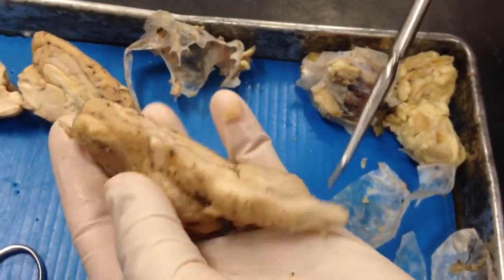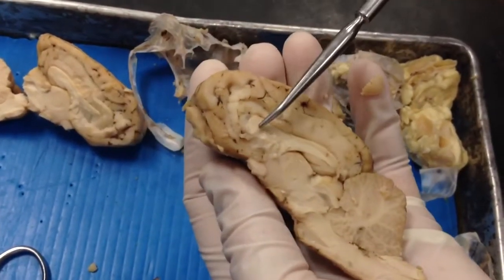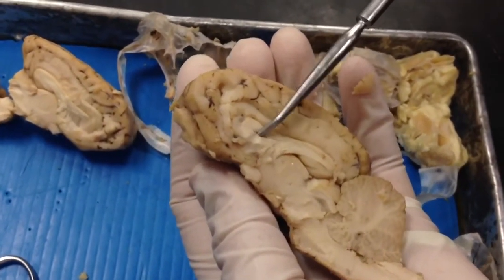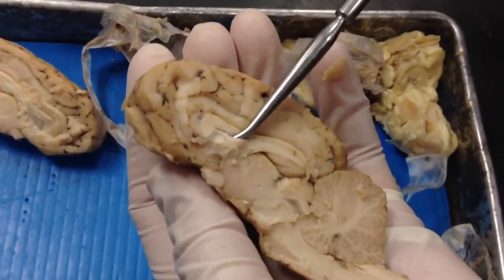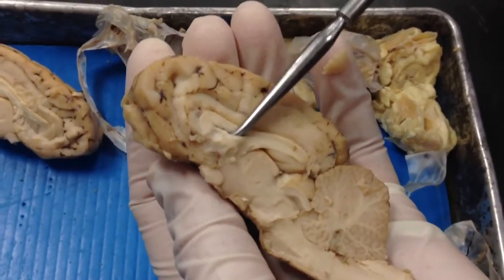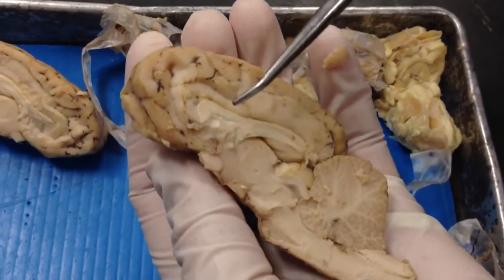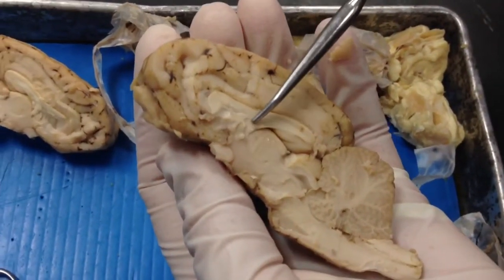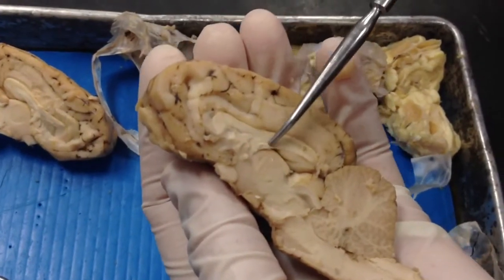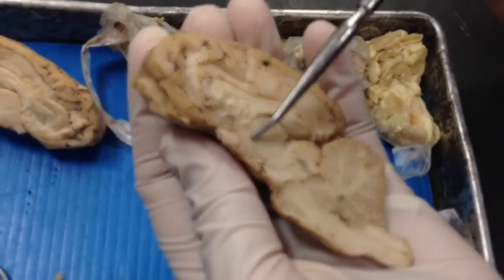The septum pellucidum is right here. The lateral ventricles are in here. The fornix is right here on the bottom. And the thalamus.